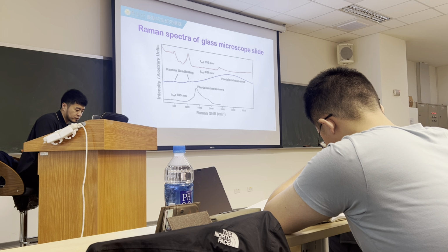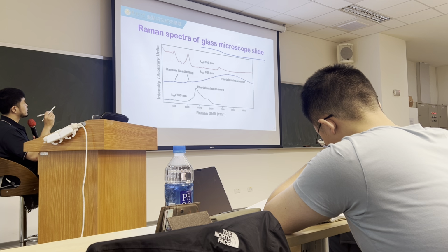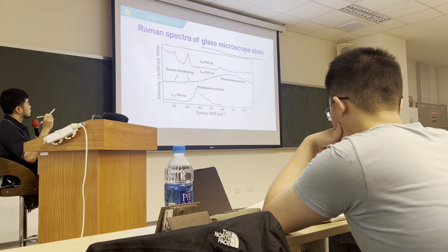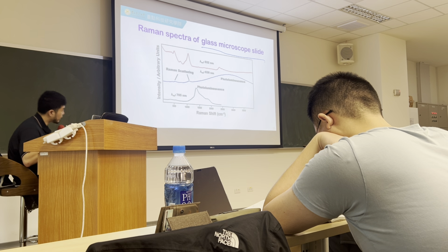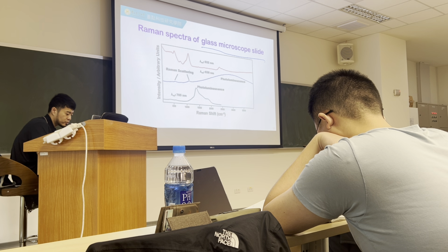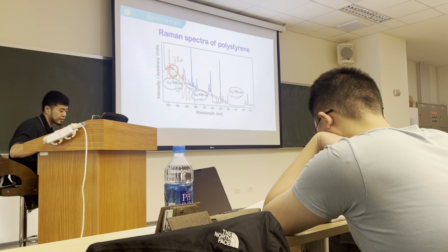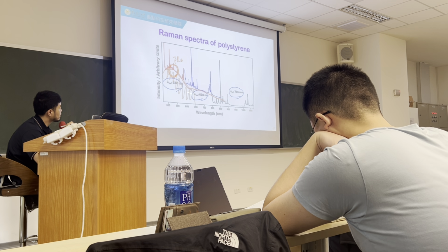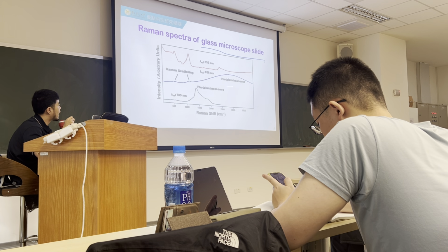So based on this, you can understand that the glass slides have a significant fluorescence around 600. I did not prepare that over here. So if you plot that for the absolute result, you can know that the fluorescence in that case is different from this case. In this case, the fluorescence is more serious at the low wavelength, but in that case, the fluorescence is more significant at the high wavelength.